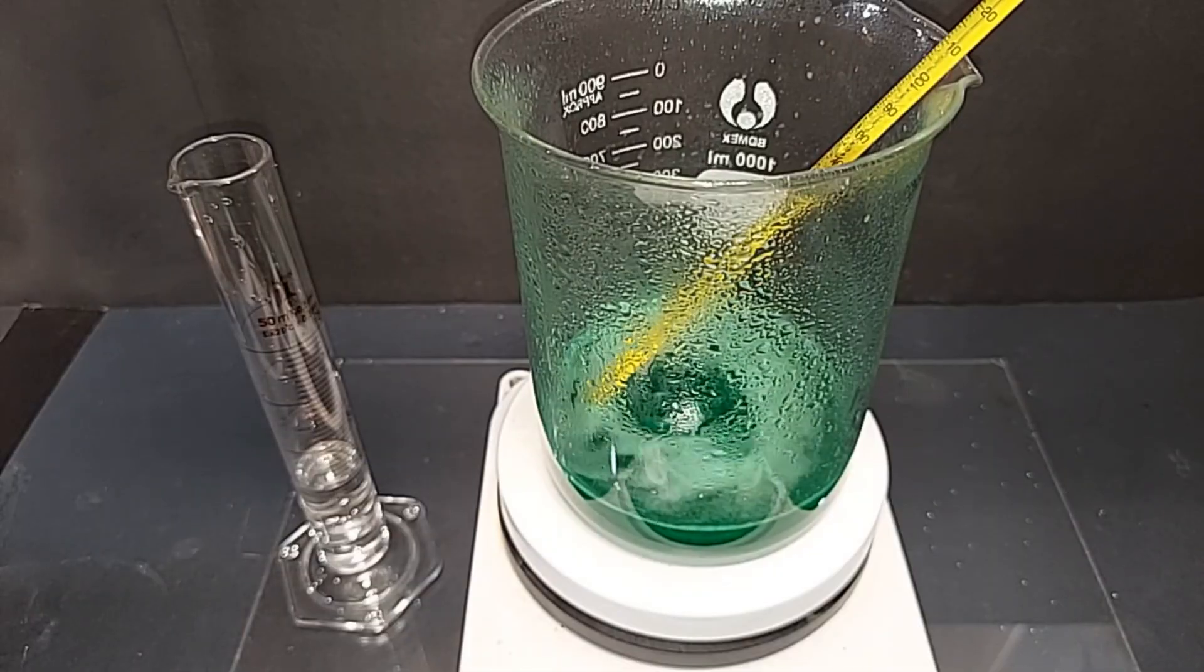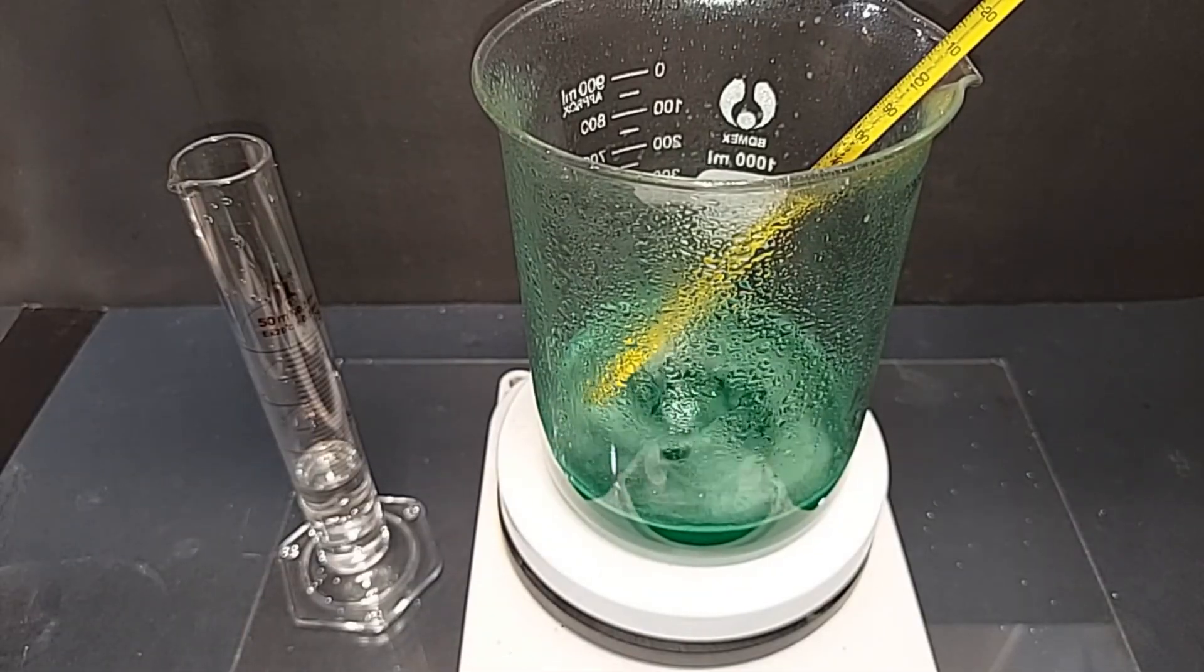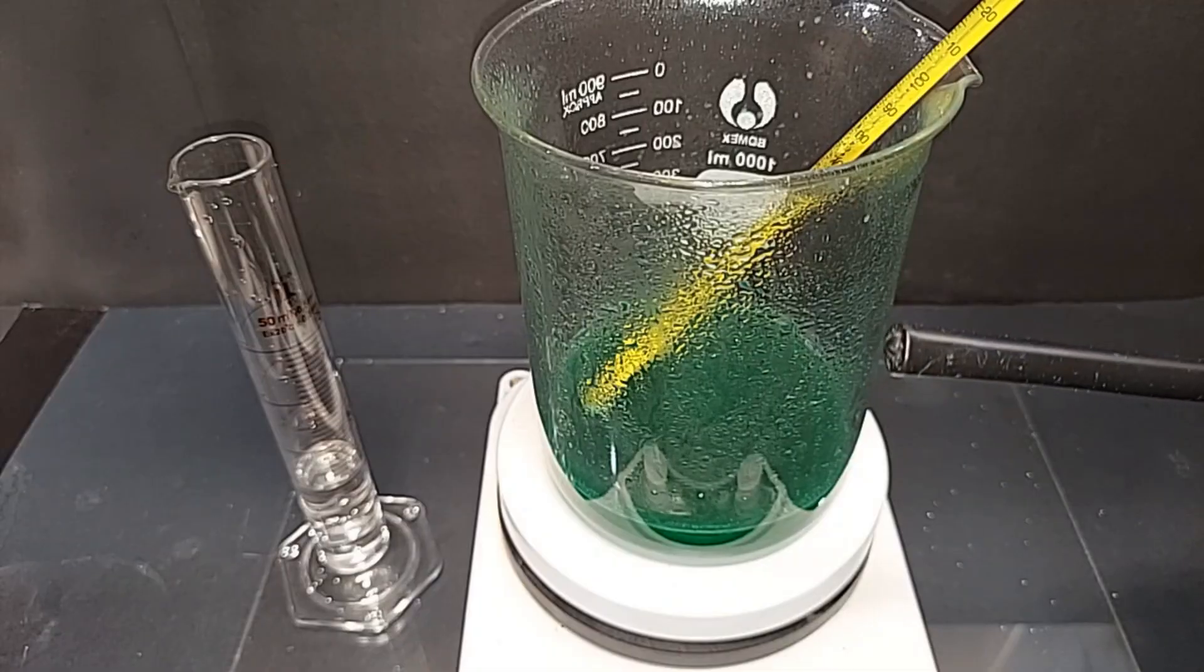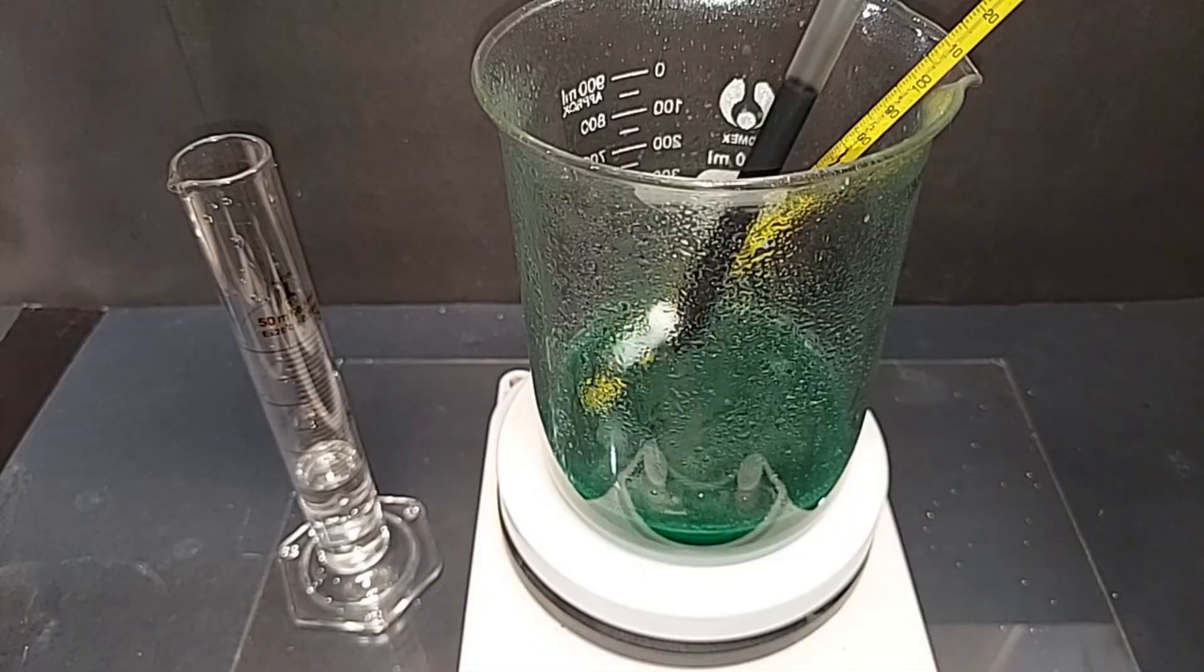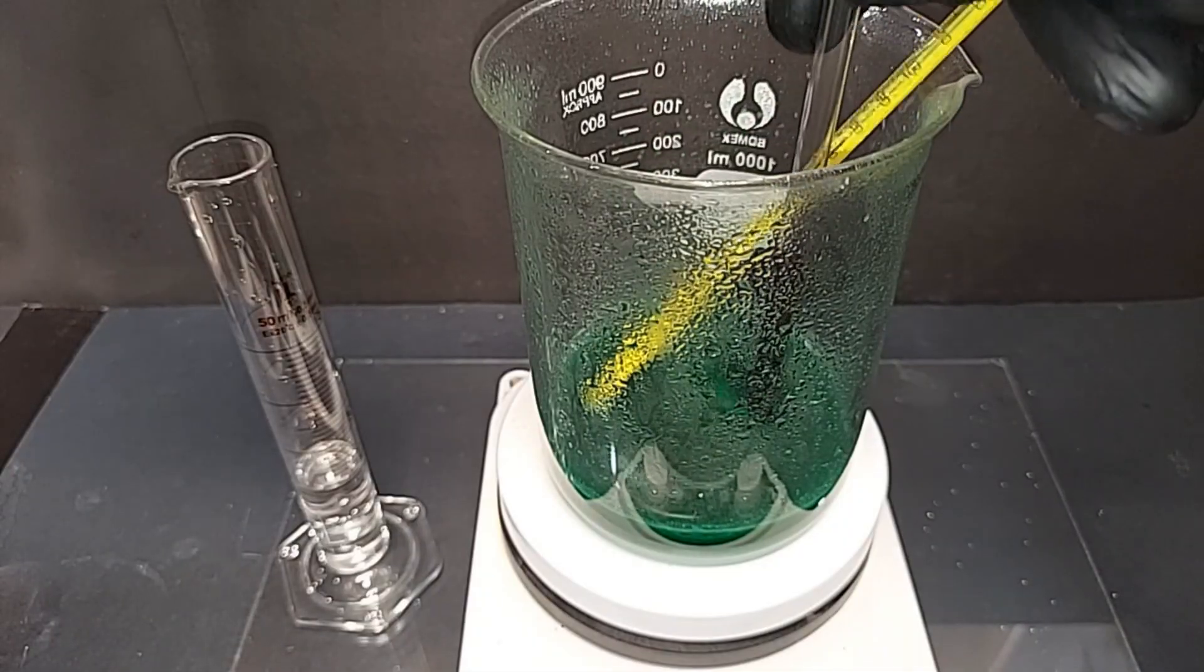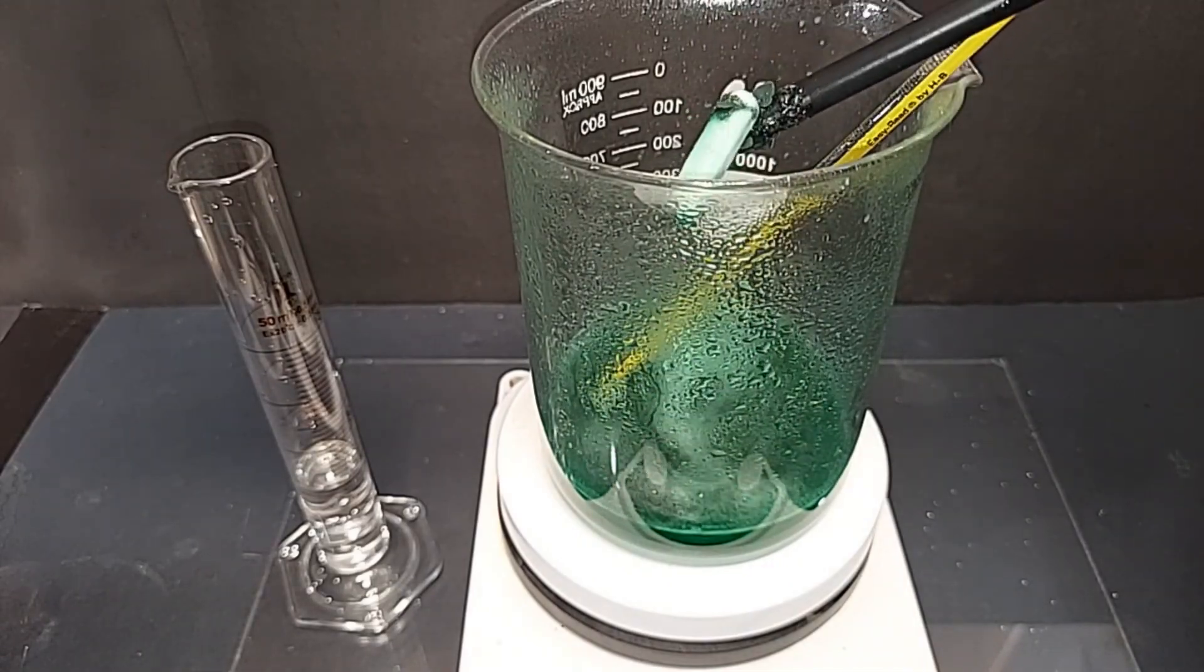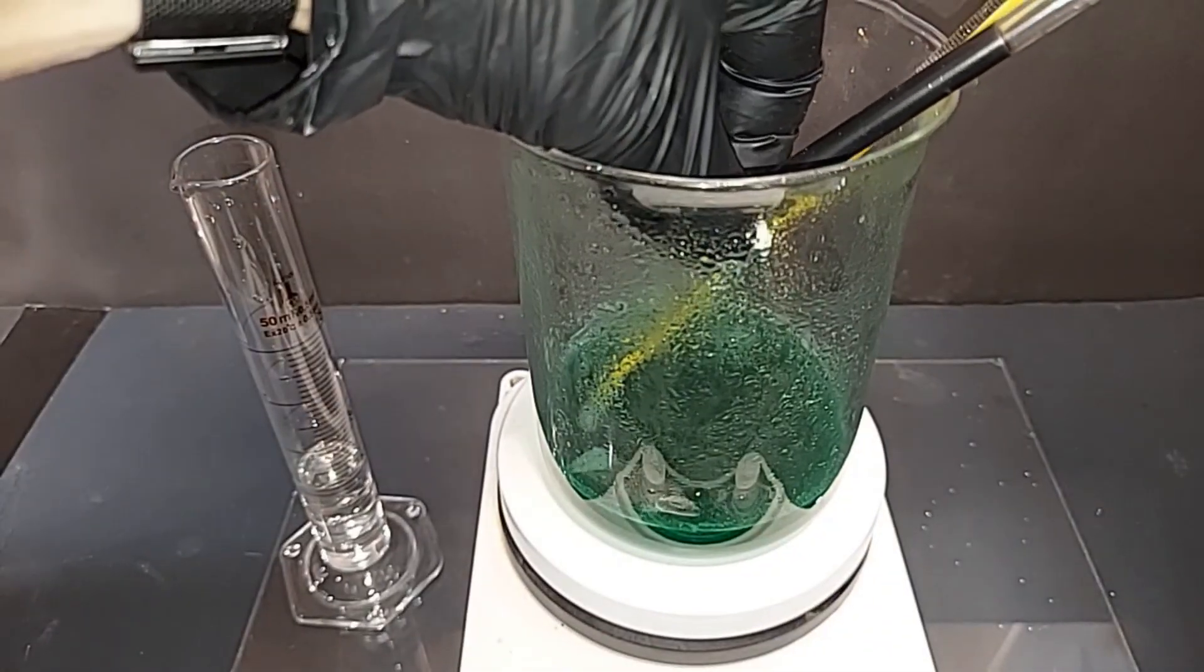I'm going to turn off the magnetic stirrer here. It's hard to tell if there's any metal particles in there anymore, so I'm going to let that die down. This is simply a tube with a magnet stuck on the end that I coated so that acids don't get to the magnet. Let's see - well there's a magnetic stir, you can see it's got a few particles left of the nickel. Oh yeah, there's quite a few left. All right, put this all back in there and keep doing this until it's all gone.